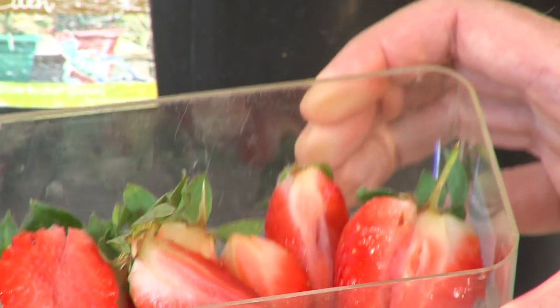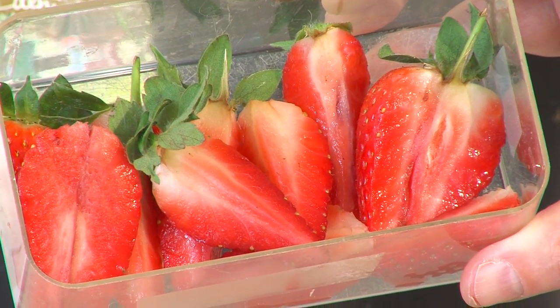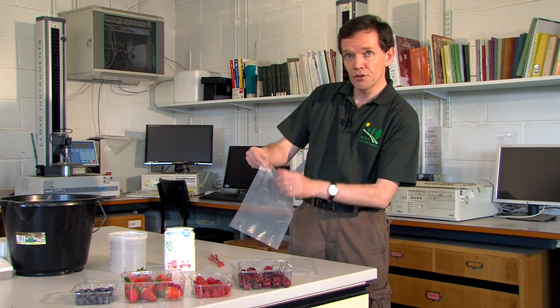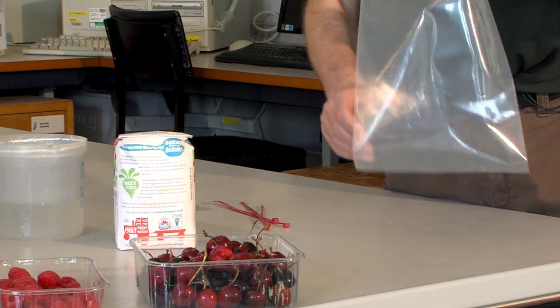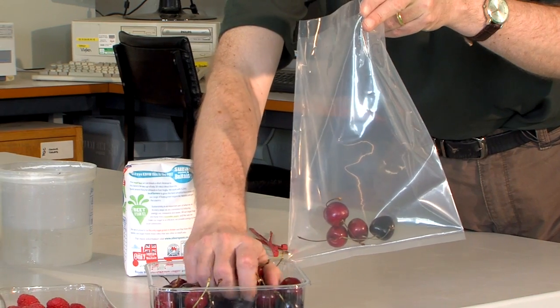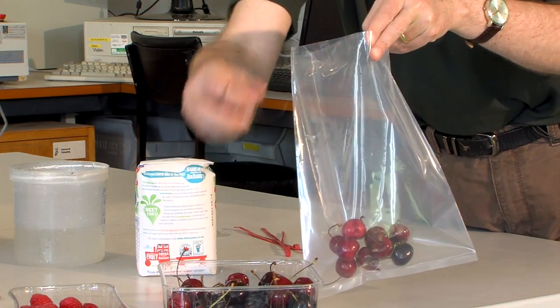For larger fruits like the strawberries, we would suggest that the fruit is quartered like this. It just makes it easier for the larvae to escape. You put about a hundred grams of fruit into the bag. Incidentally, it's very important that the fruit is ripe or semi-ripe.